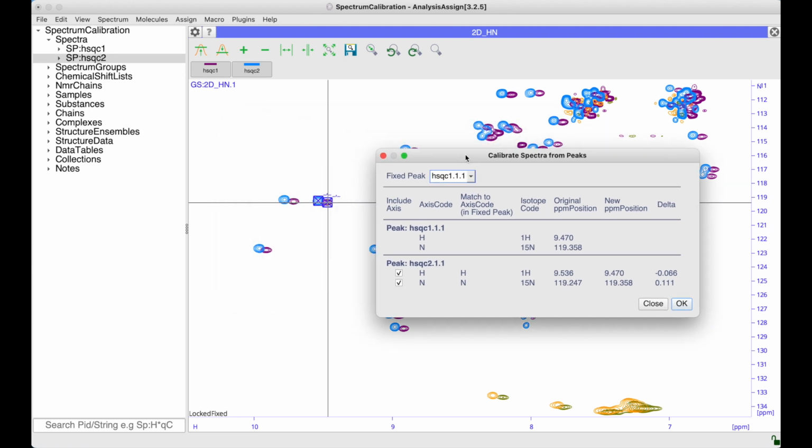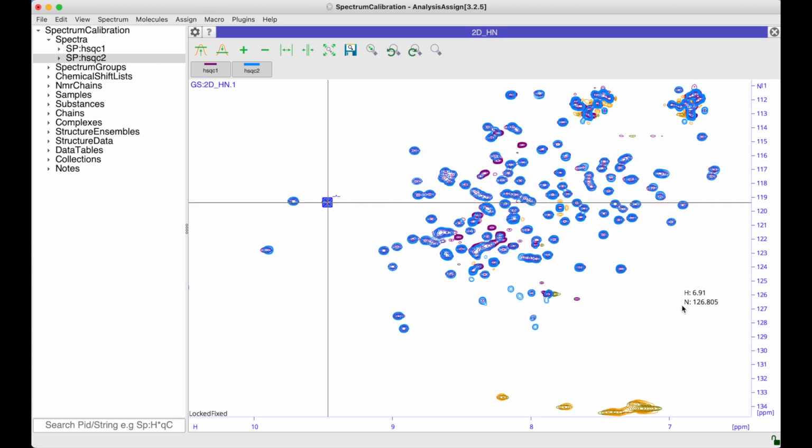This basically specifies which of these two peaks will stay in the same position, and then any other peaks that have been selected can be moved to align exactly on top of that peak. So you can see here we've got HSQC2, and for each dimension it's showing us where that peak is at the moment, where it would be if it's being made to overlay with this other peak, and then delta here is the difference, the amount by which the spectrum is going to be moved. So simply select whichever dimensions you want to move and then go to OK. And now the spectra overlay nicely.